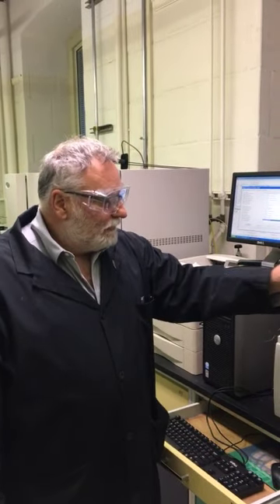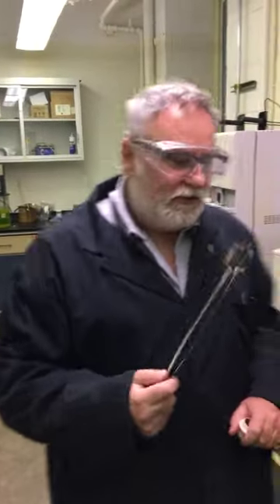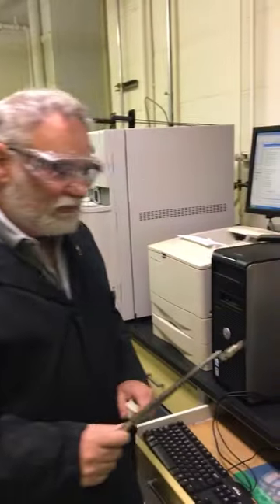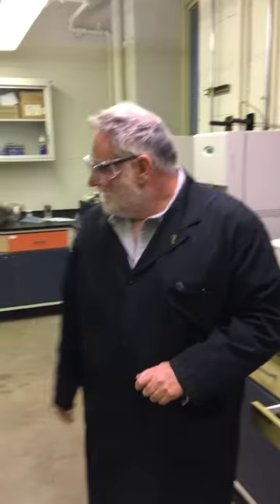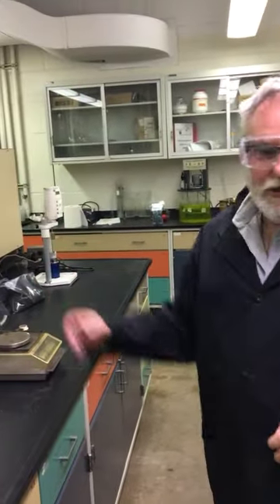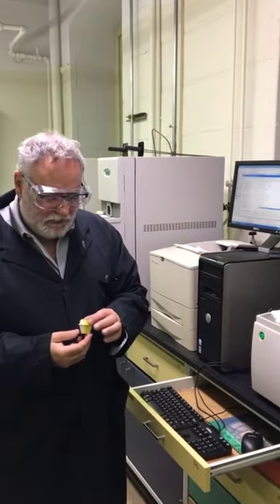Once that occurs, we take them out and we use tongs to make that easier. And obviously when it gets hot, we need to use these tongs to ensure we don't get burned. We have a microbalance sitting around the corner. We're going to put in approximately 1 gram of sample, but we're going to have it accurately weighed. Our balance is both high accuracy and high precision. It's going to go to 4 decimal places.